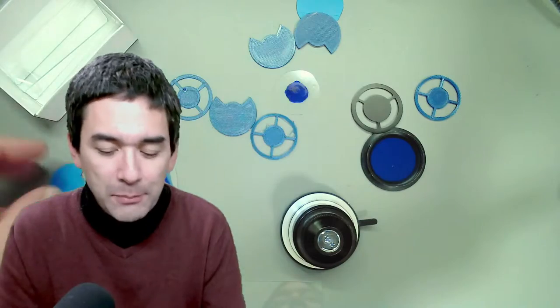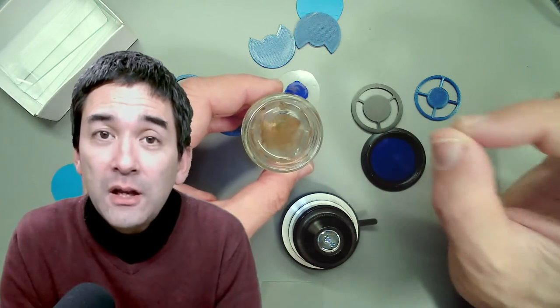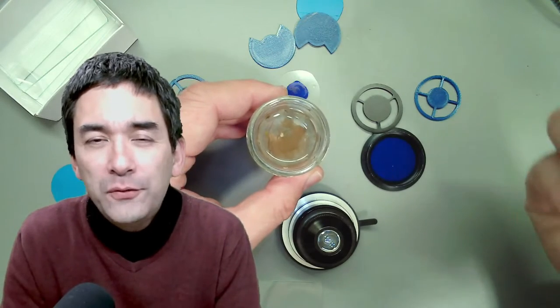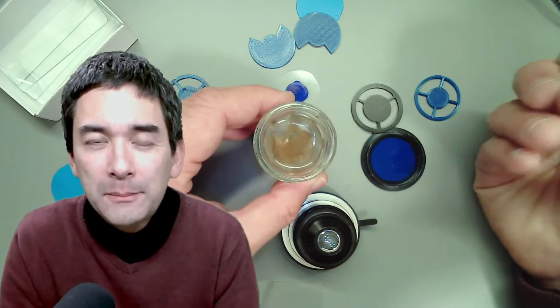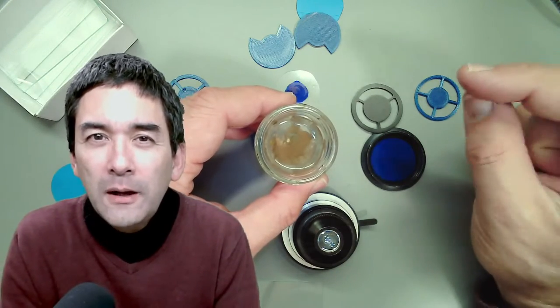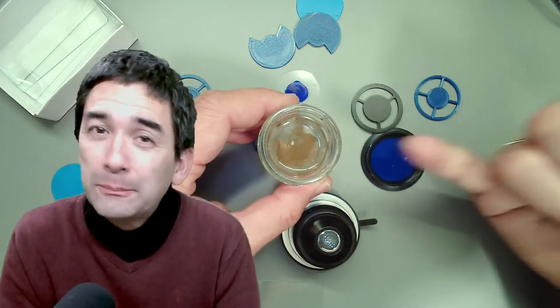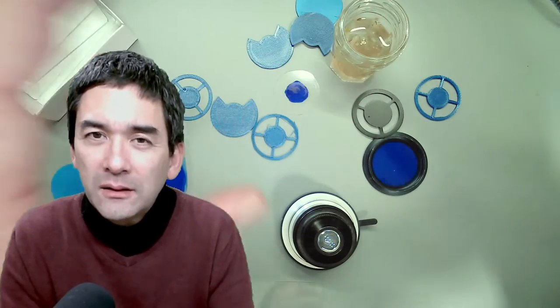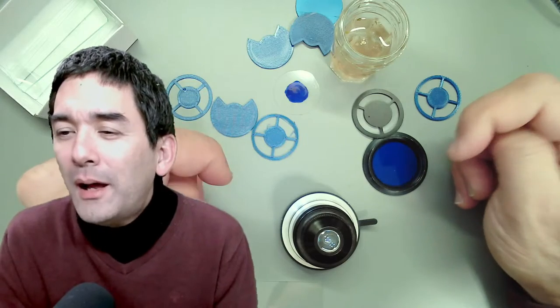Can you use milk? Yes, it is possible to make a milk culture. Instead of adding a crushed wheat grain, you can add a very small amount of milk — just enough that it turns a little bit cloudy. After a few days the cloudiness will disappear because the fat droplets have been eaten up by the protozoa. It's really important — if you add too much milk, bacteria will grow faster than the protozoa and take away oxygen, so the protozoa cannot grow. Wait until the cloudiness disappears and this means the protozoa have eaten up the milk.